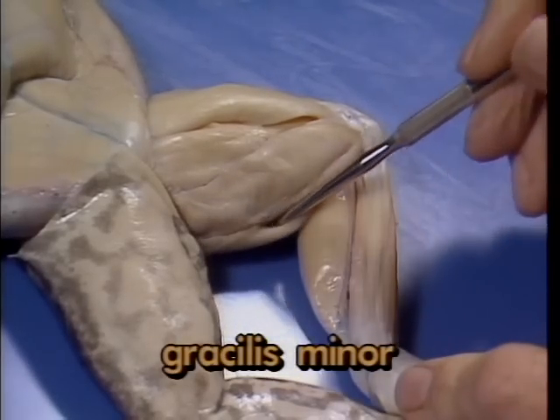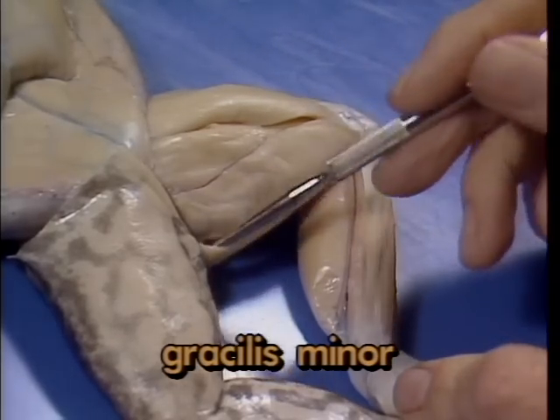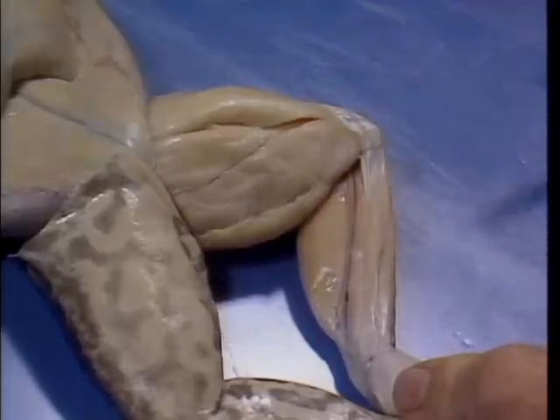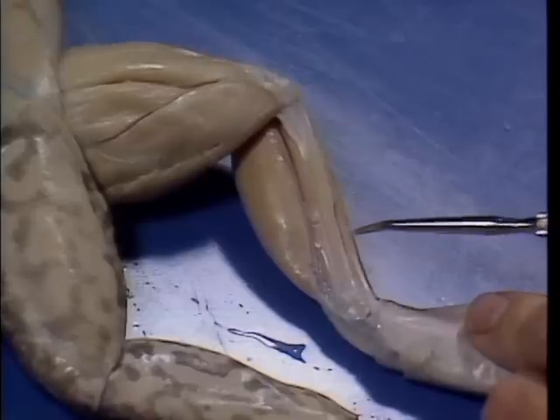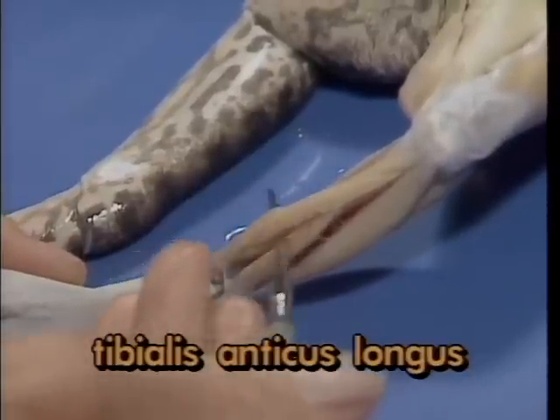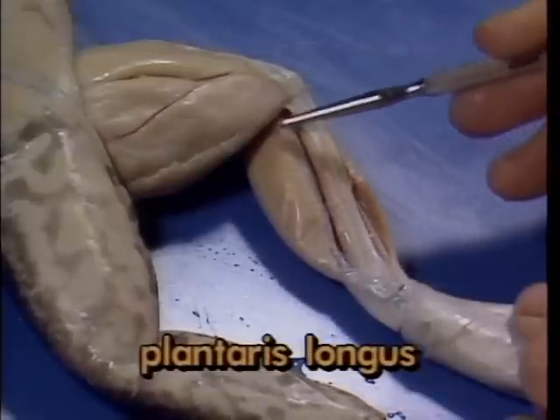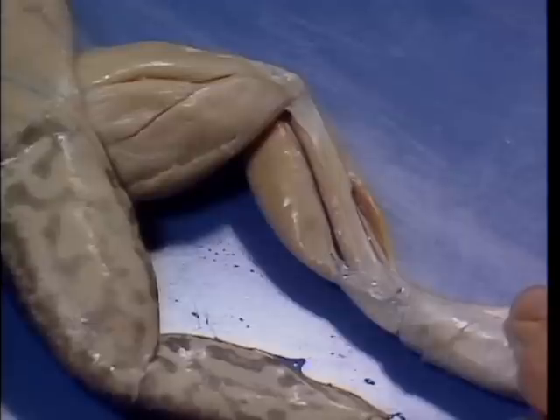The gracilis minor is a thin slip of muscle which covers the posterior surface of the gracilis major. It functions much like the gracilis major, and completes the series of ventral thigh muscles. On the shank ventrally, there are two large muscles, one on either side of the bones of the lower leg. Shown here is the tibialis anticus longus on the lateral surface. The larger, more medial muscle is the plantaris longus. Both of these muscles contribute to extending the foot.